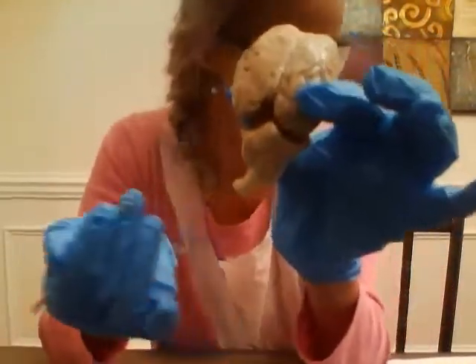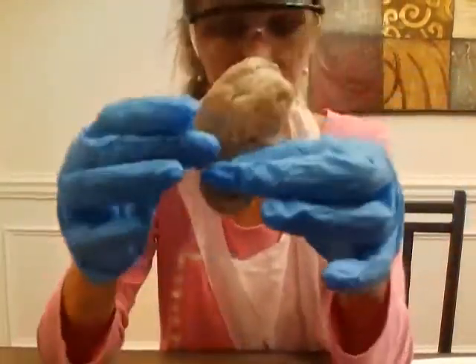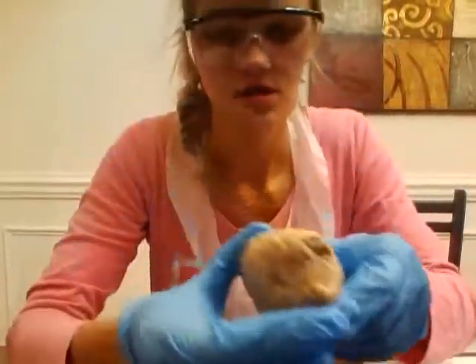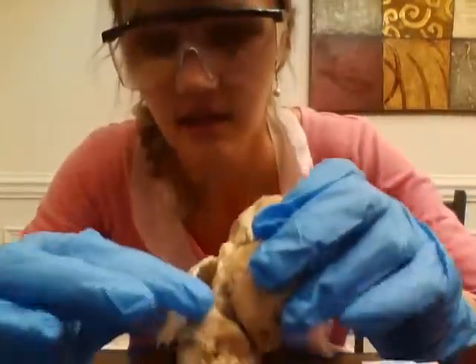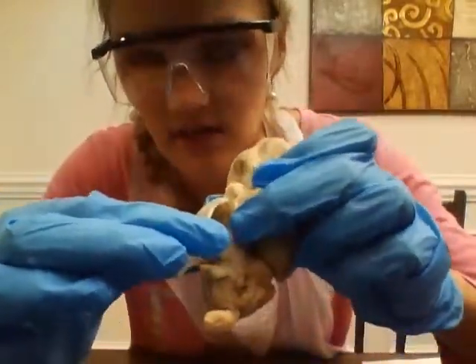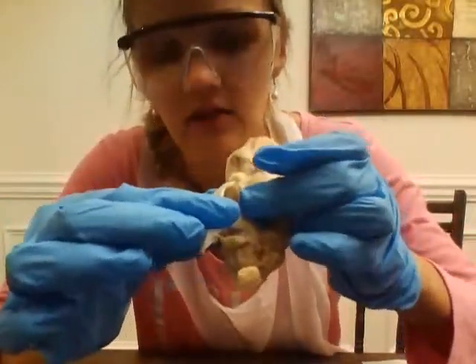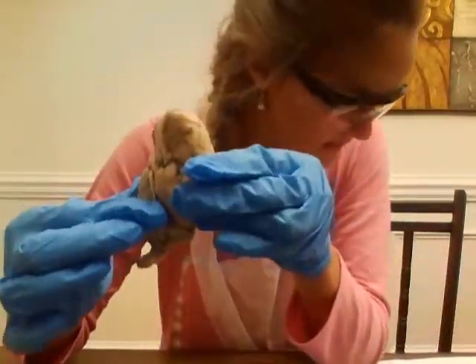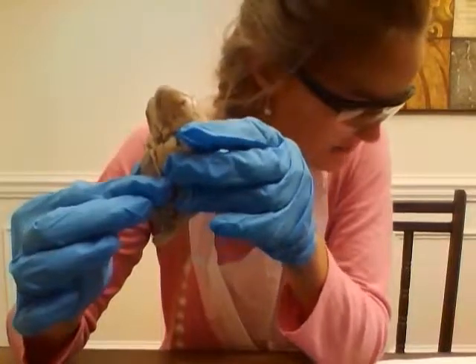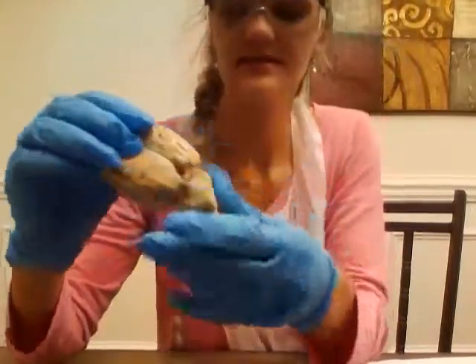And then we have the brain stem right here. Then we have the midbrain. And for the cerebral peduncle, you can kind of see mine, it has the oculomotor nerve right here. Hopefully I can give you a better view when I do the mid-sagittal, but it's right where the oculomotor sits underneath the optic chiasm. Then we have the superior colliculi.